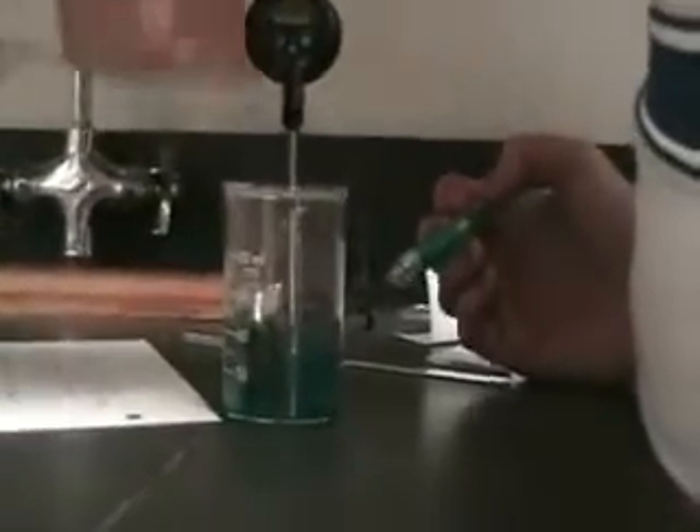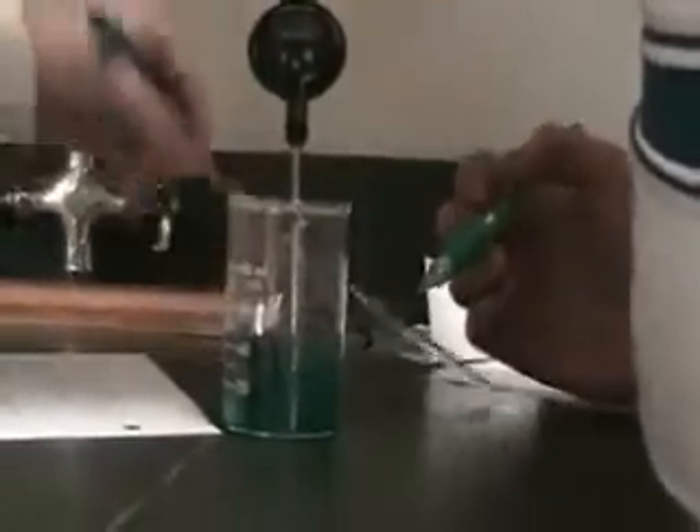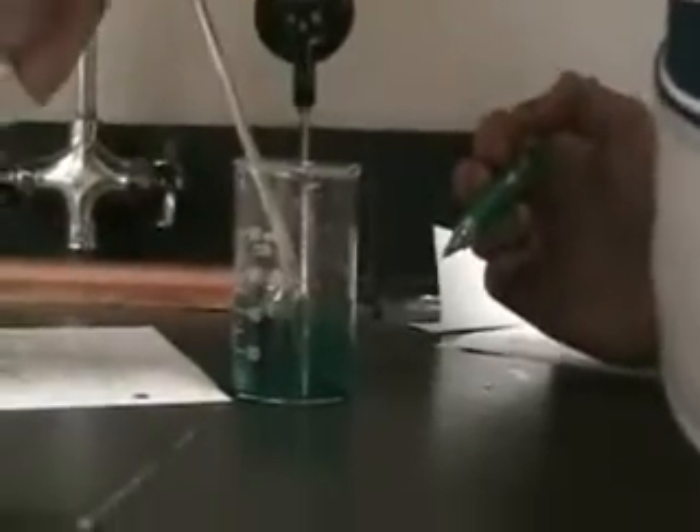It's like coming up — it's turning red. It's on the side of this, it's aluminum foil, and it's going away. So it's turning red, it's bubbling. Go ahead and push it right down in there. It's bubbling. It's breaking apart.